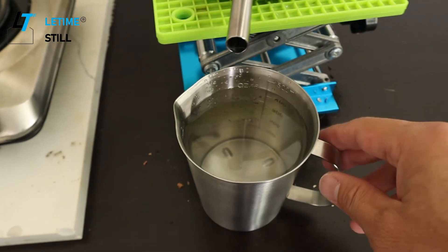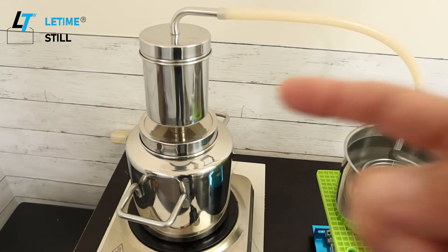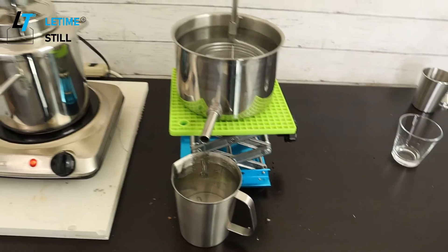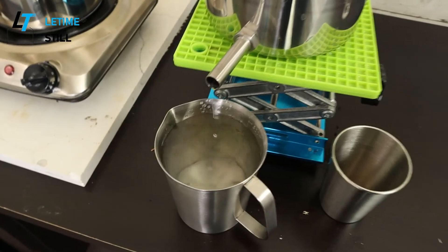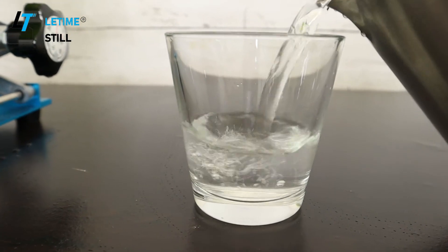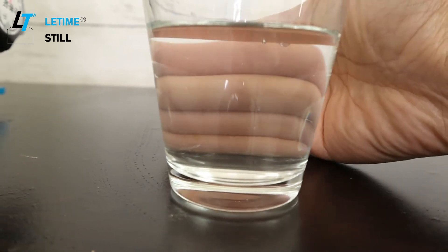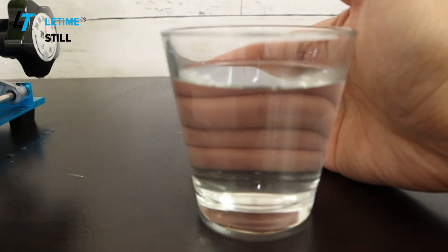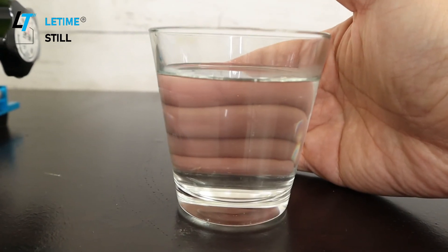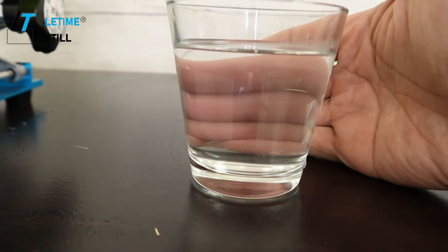After 45 minutes, I collected one cup of hydrosol. With one batch of the material, normally one cup to 500 milliliters is the recommended amount of hydrosol to make. The color of the hydrosol is obviously not as milky as lavender or other high oil content materials, which makes sense because willow bark has low oil content.